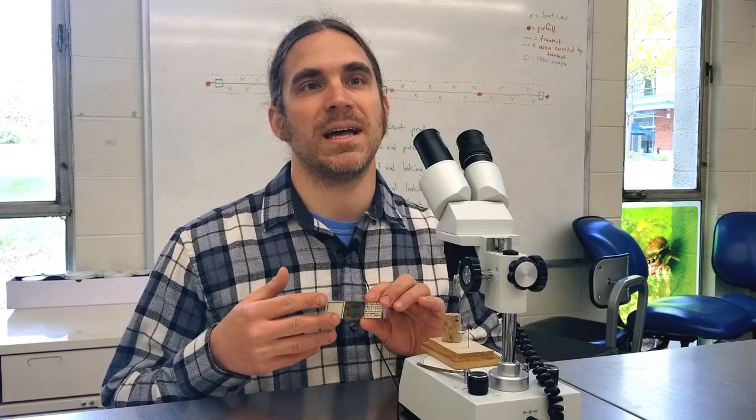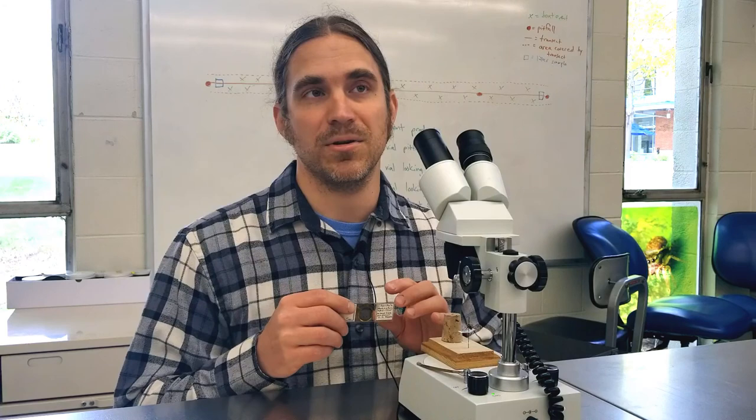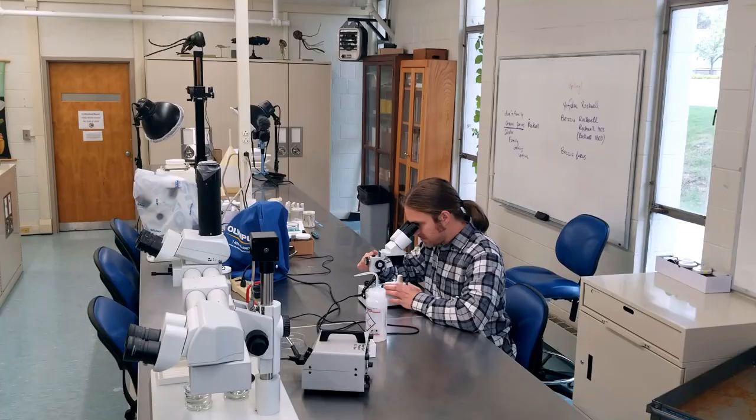Compound microscopes typically have greater magnification so you can see smaller details. You can view slides under a stereomicroscope, but you generally don't have the zoom or resolution needed to see the characters. Other types you may have heard of are scanning electron microscopes, which are large objects that take up an entire room.